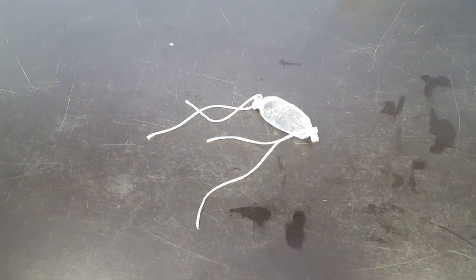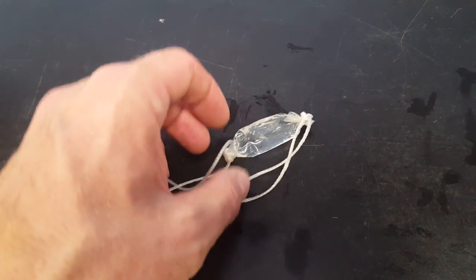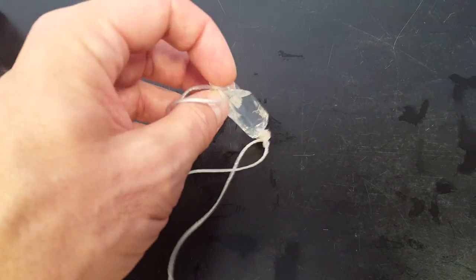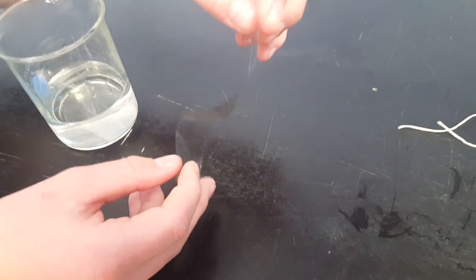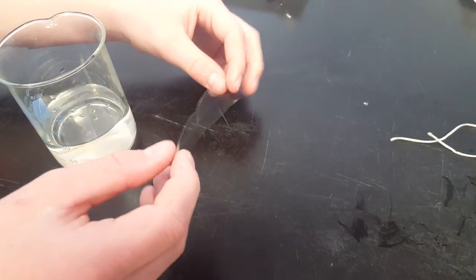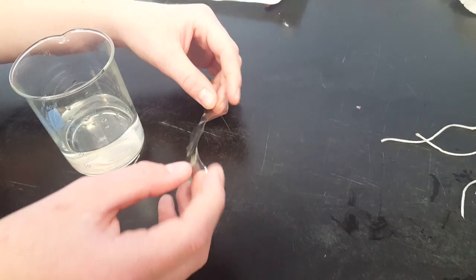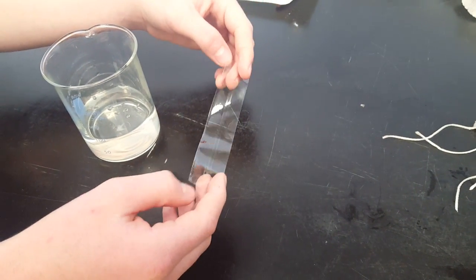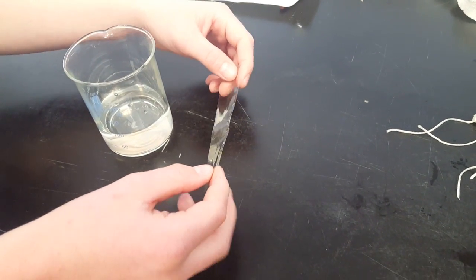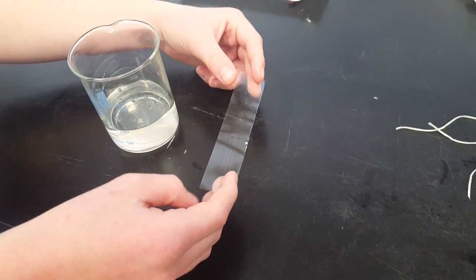In this video, you're going to see how to make a dialysis tube cell like this one using a piece of dialysis tubing. Dialysis tubing is a clear film that has tiny little pores in it, just like the cell membrane of every one of your cells. In fact, they're about the same diameter in the cell membrane as they are in this dialysis tubing. That's why we can make an artificial cell out of a piece of dialysis tubing.